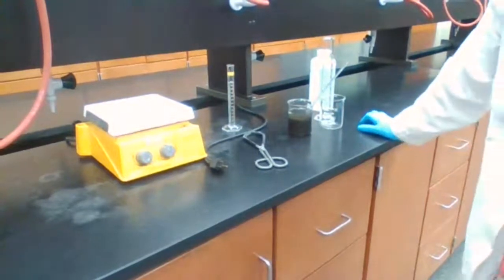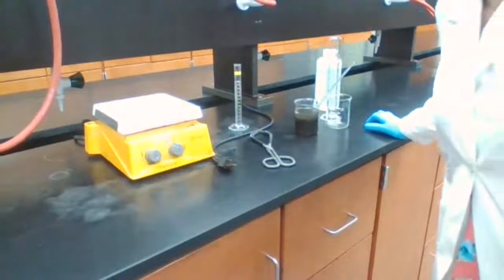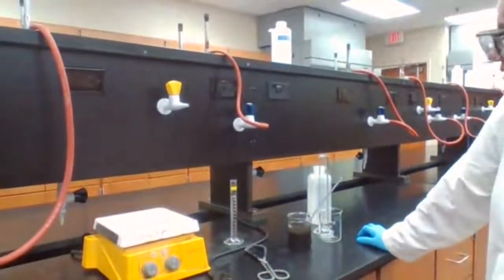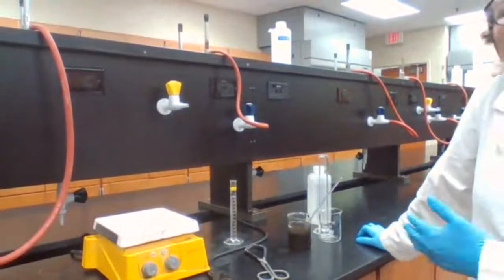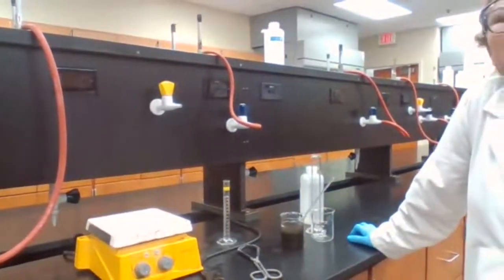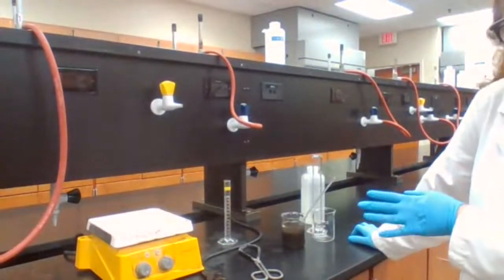What are we adding after sulfuric acid? Do you have it up there or not yet? After the sulfuric acid, maybe I can magnesium. Okay, maybe I can measure the magnesium while we are waiting for this. That way we're not rushing.